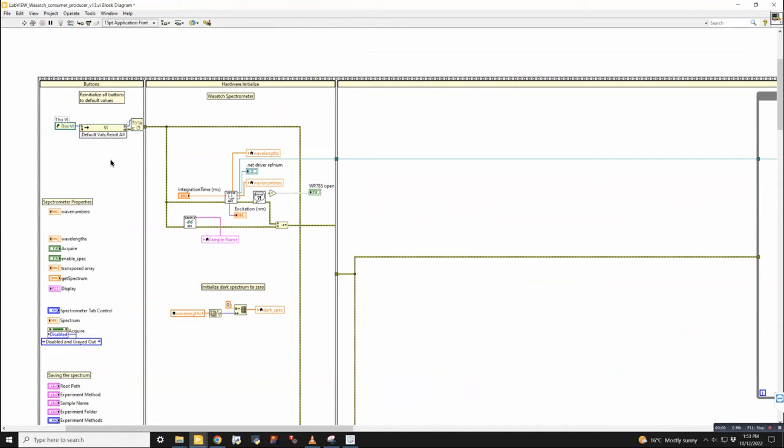And this is nice because if you're programming, sometimes if something carries over from the last session into the current session, it could cause errors. If you have true values that should be false or false values that should be true, it's a huge nightmare for troubleshooting. So I found it to be really helpful to start from a clean slate and define all of your variables from some sort of default initialization and then go from there. So that is the very first thing that we do.